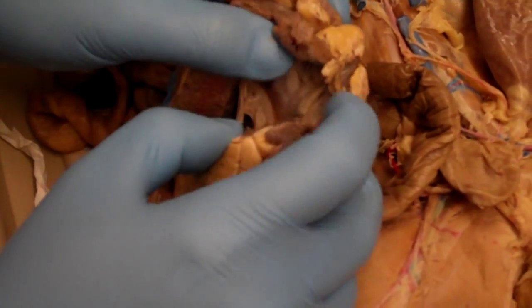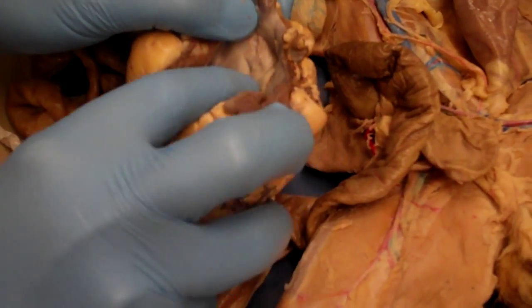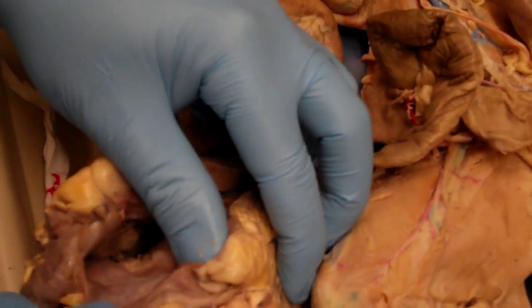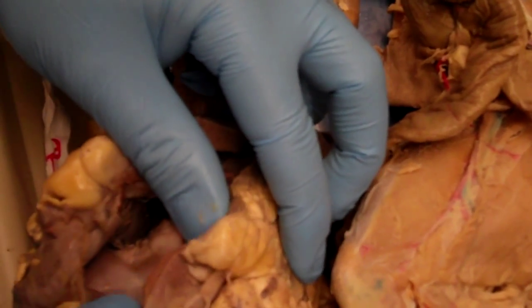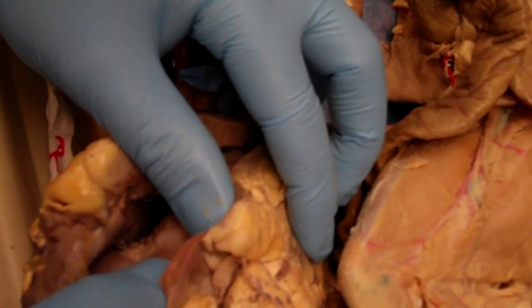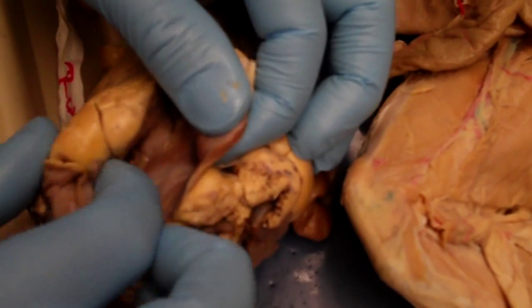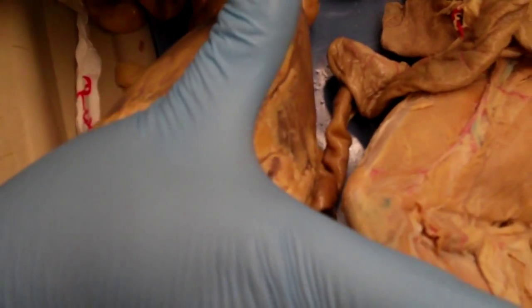septum. So really when you open up an atrium and you're looking at it, you're looking at the interatrial septum. Because if I push on this, what happens is my finger will bulge into the other atrium. And so what's preventing it from simply passing through is that partition. Because remember, when we cut this guy open, this is part of the atrium as well. Out here, it's a round structure that we've cut and then opened up.